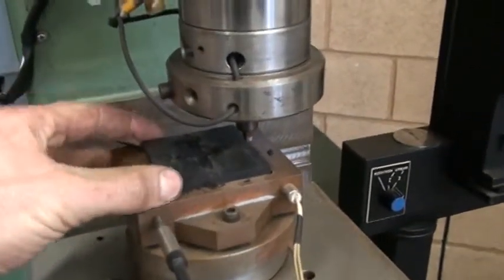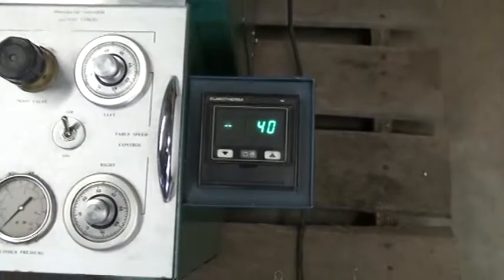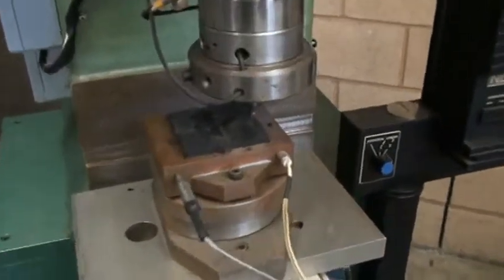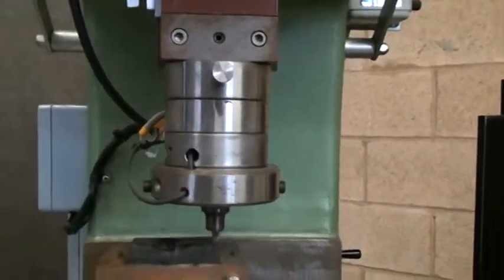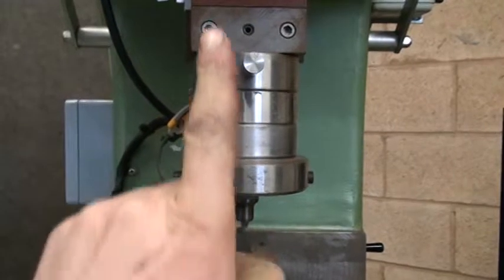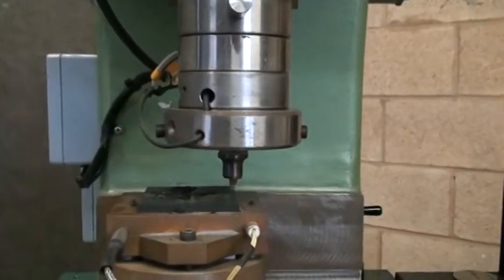Here's the sample and here's the holder, and this holder is temperature controlled with that controller there. In the head there are three load cells. The first load cell measures forces vertically, and the other two — one on each side — check the forces when the top is dragging across the rubber.